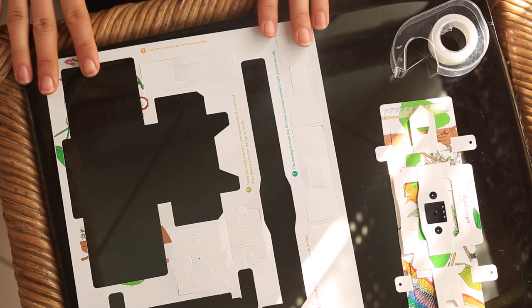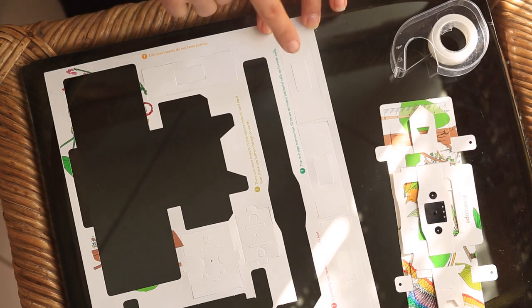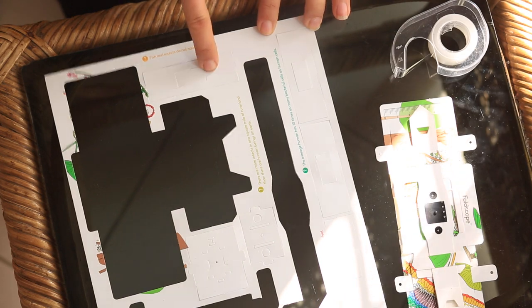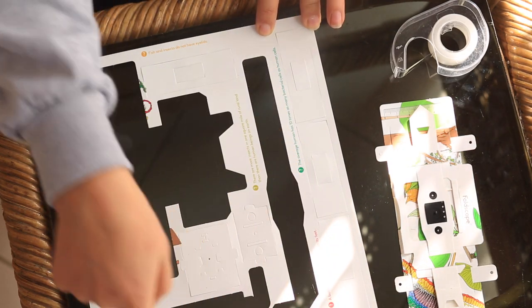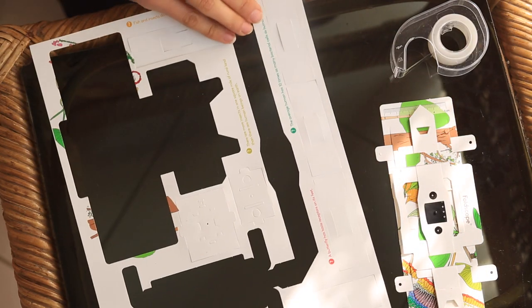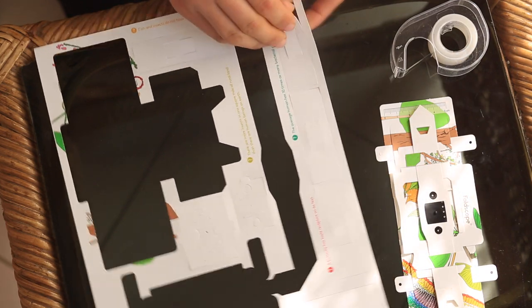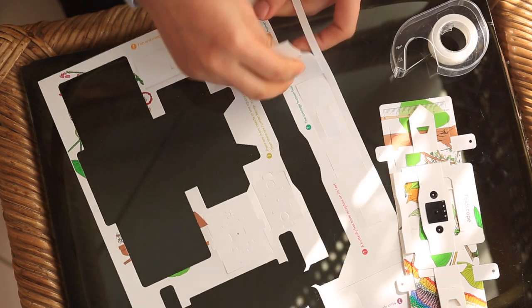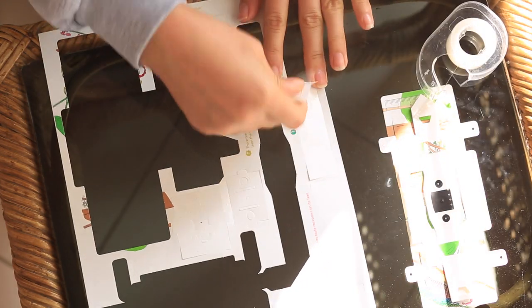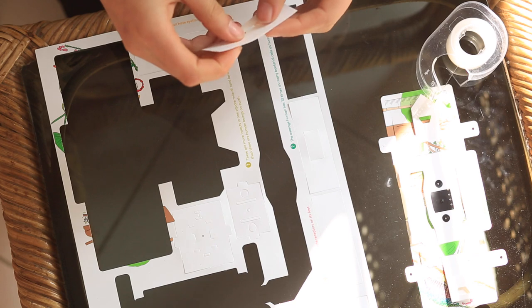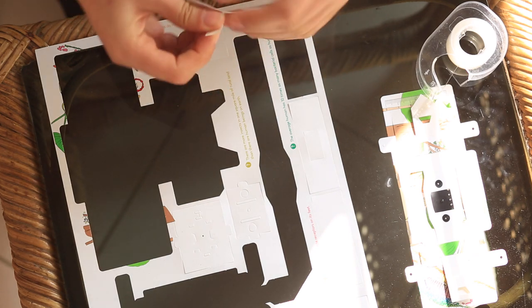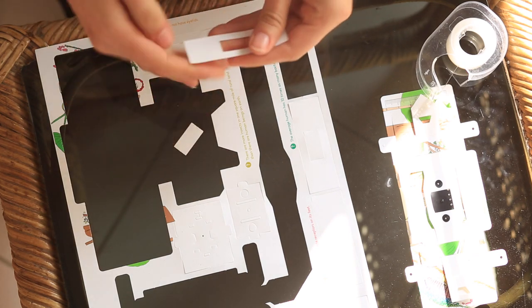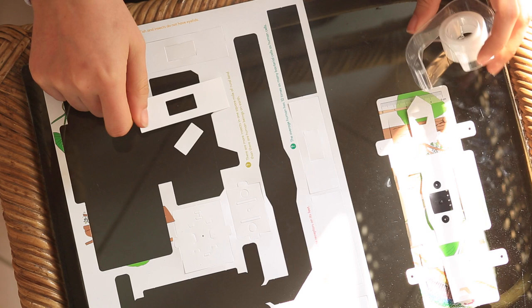Along with your Foldscope on your Foldscope paper, it comes with six paper slides. So the way that a paper slide works is you punch it out similar to the way you punched out your other pieces. You take out this center part and you have a slide like this.